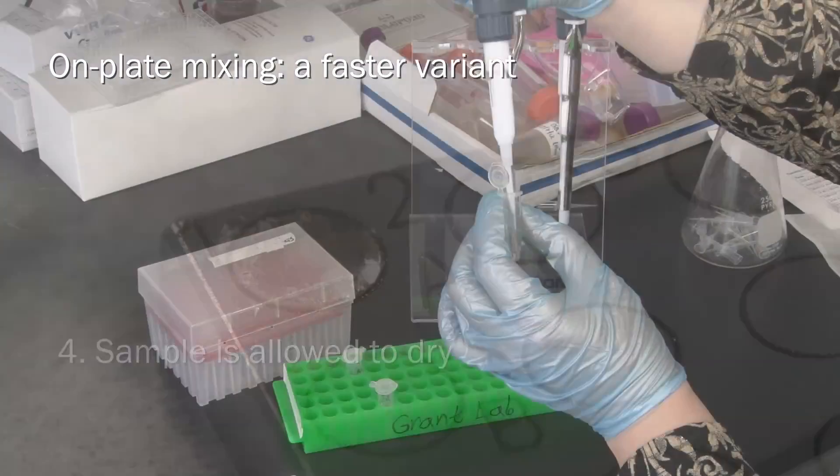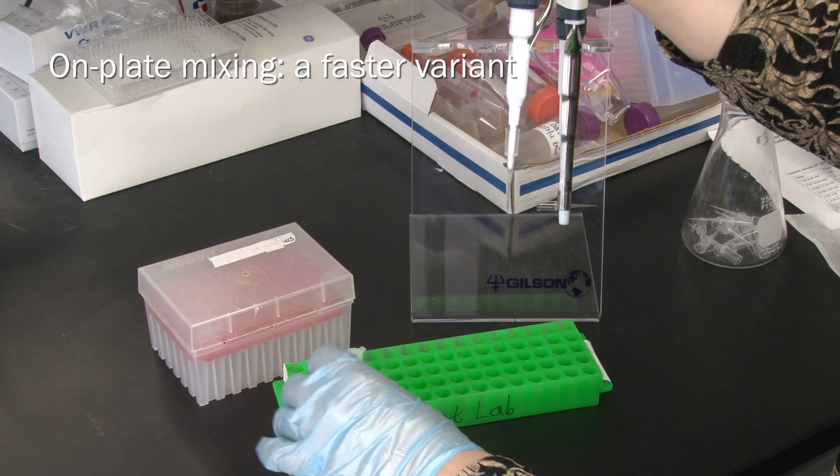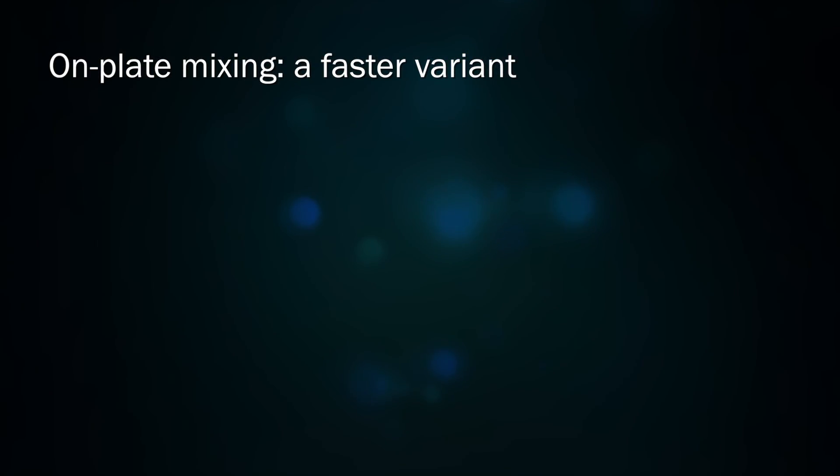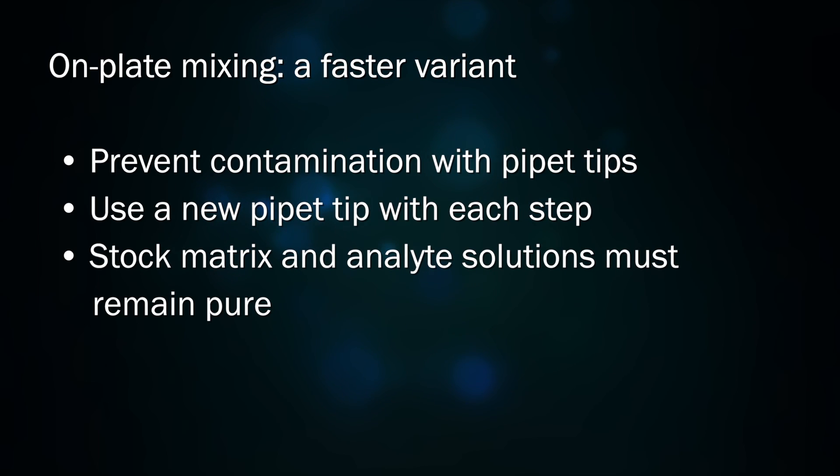This allows the stock analyte and matrix solutions to remain in separate tubes, as they are only combined on the plate. While it's always important to prevent cross-contamination with pipette tips, it is especially critical to use a new pipette tip with each step in this method to ensure that the stock matrix and analyte solutions remain pure.